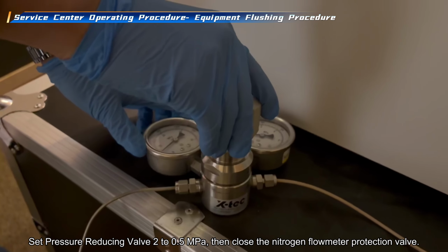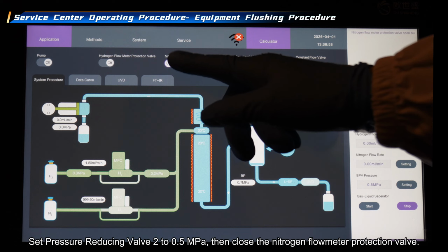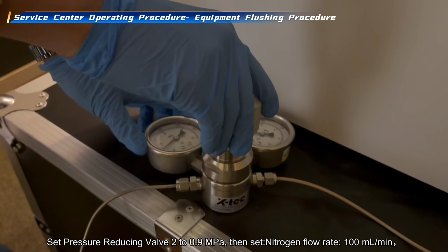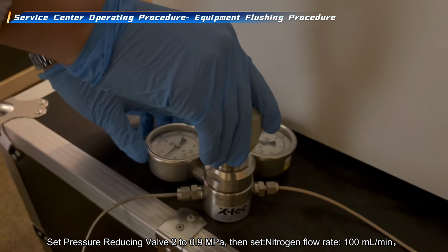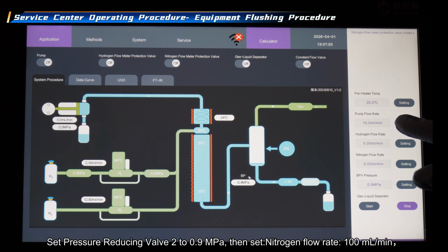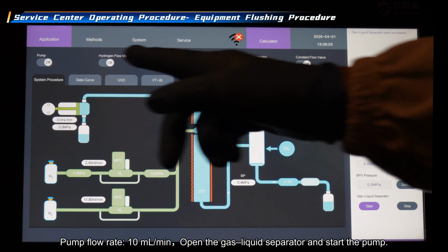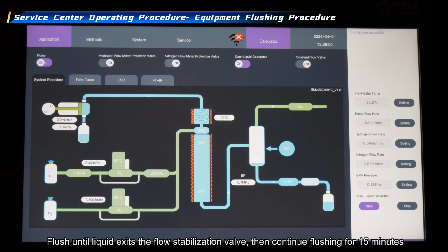Set pressure reducing valve 2 to 0.5 megapascal, then close the nitrogen flow meter protection valve. Set pressure reducing valve 2 to 0.9 megapascal, then set nitrogen flow rate 100 milliliters per minute. Pump flow rate 10 ml/min. Open the gas liquid separator and start the pump. Flush until liquid exits the flow stabilization valve, then continue flushing for 15 minutes.